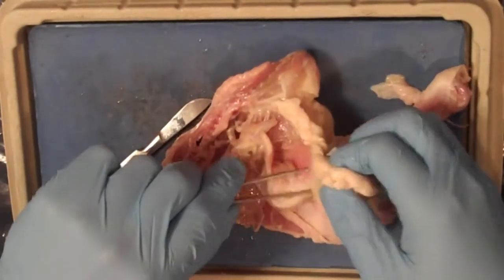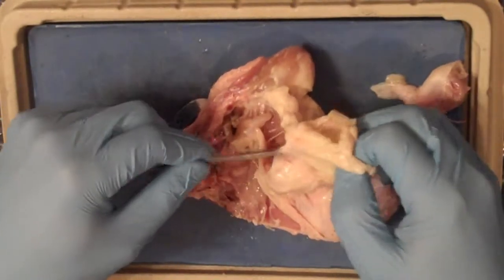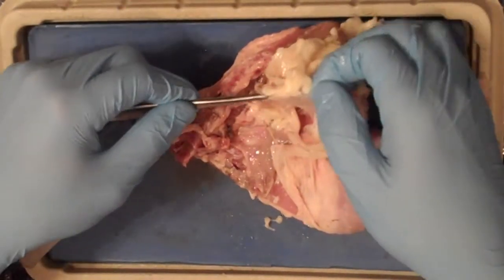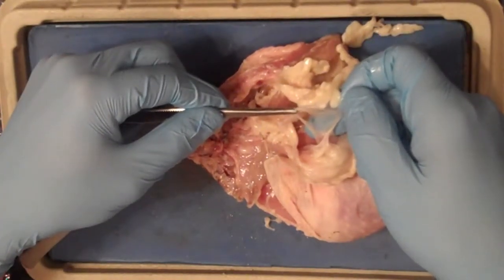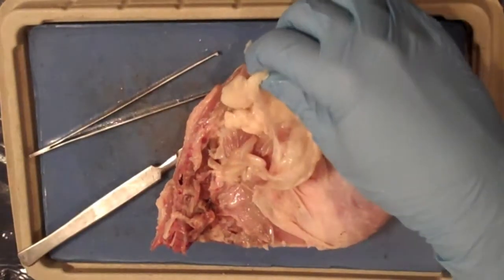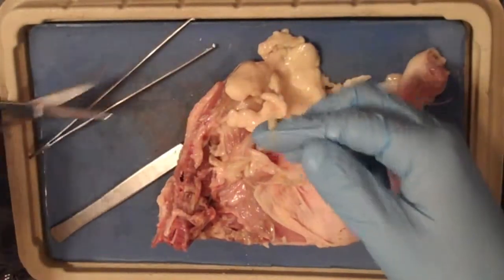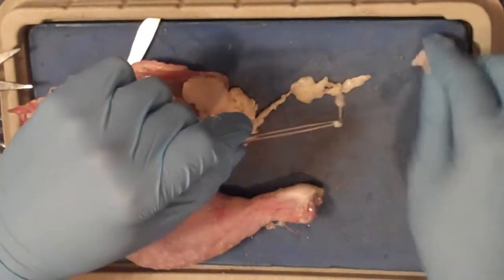The next tissue you're looking for is areolar tissue. If you remember from when you observed areolar cells, they're small cells connected by thin elastic fibers. And you'll see the same structure when you look at the entire tissue. It almost looks like a thin, clear spider web. You should be able to find it all over the chicken, usually lining adipose tissue and underneath the skin cells. If you remember, its function is to supply the skin with blood because the skin can't get the blood without the areolar tissue. So try to stretch some of it out, see if you can remove some of it and cut a piece off of it so that way you can look at it under the microscope.